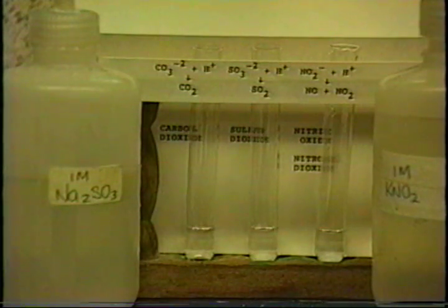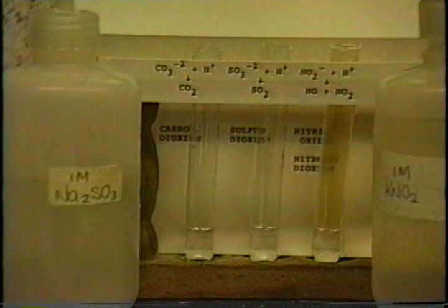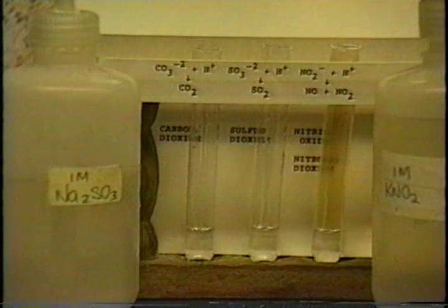You may have to heat this. As a matter of fact, it's always a good idea to heat these up to make sure that you're getting complete reaction. Let's heat these and see how they change. All right, here it is after heating, and you can see a rather dramatic change. We don't have smell-o-vision, so you can't really see all the changes which have taken place, but at least this will show you some of the characteristics of these gases.